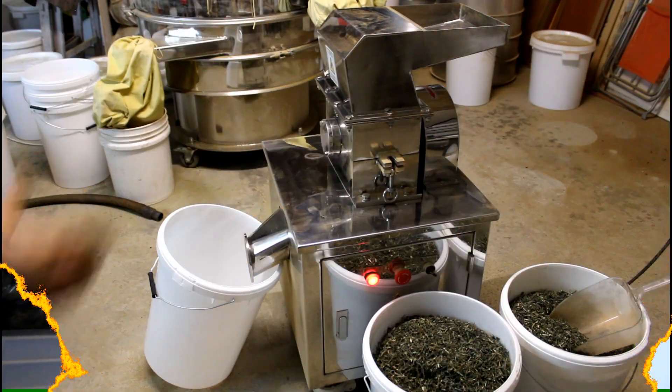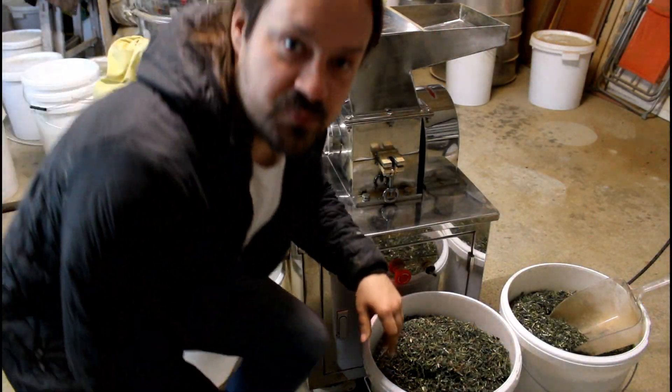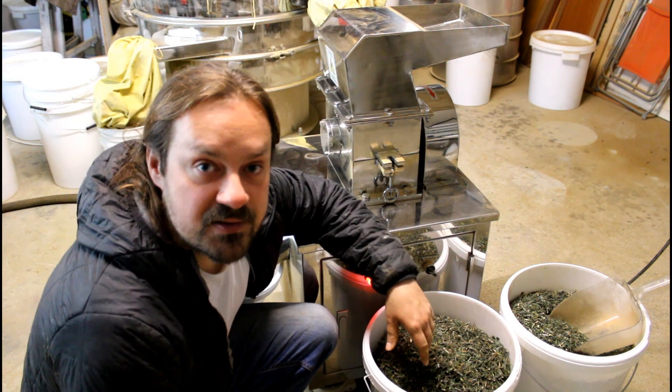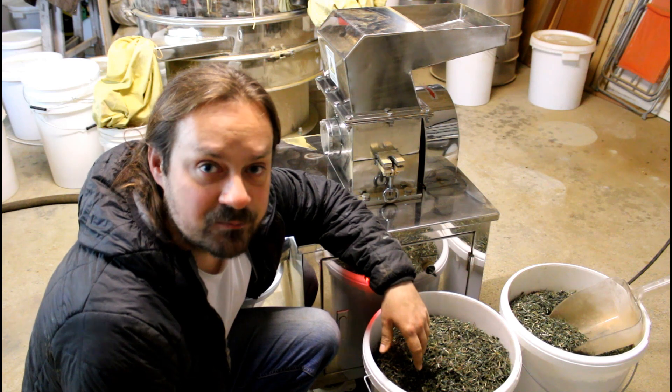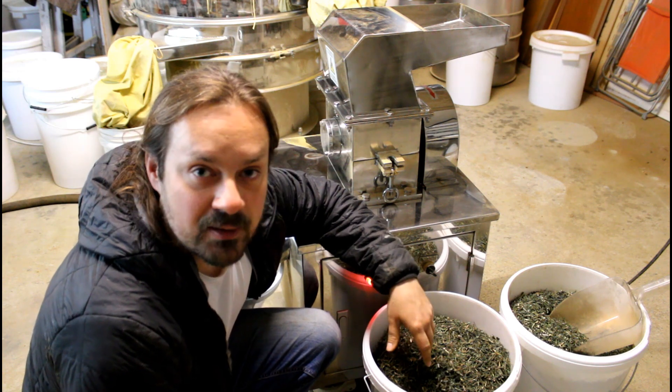And in the next step I will show you the actual extraction. So what you can see here, that's a coarse mill. And with this coarse mill I will grind the herbs a little bit.